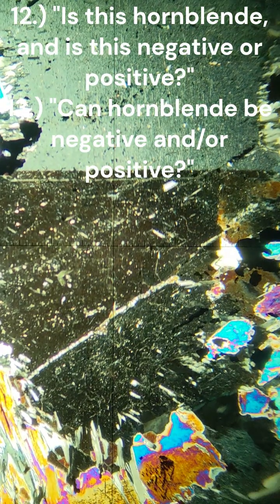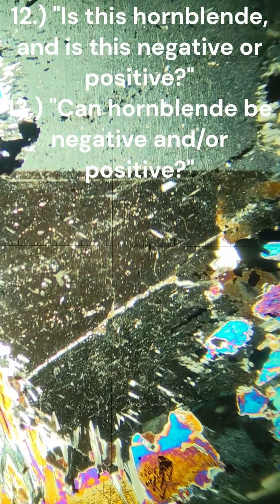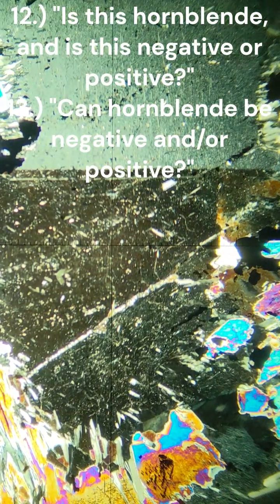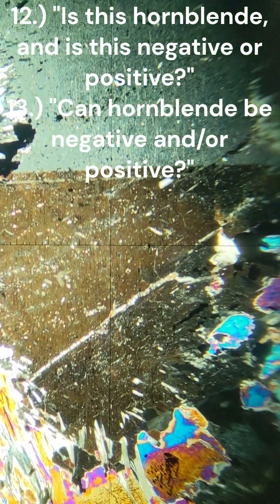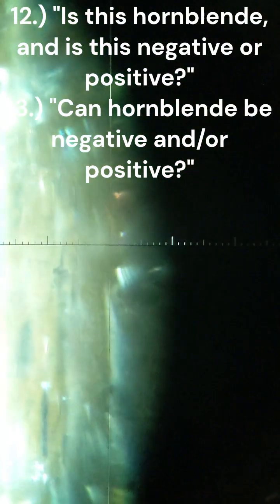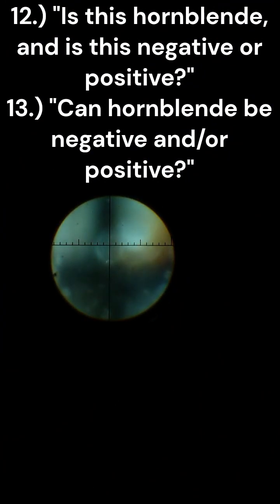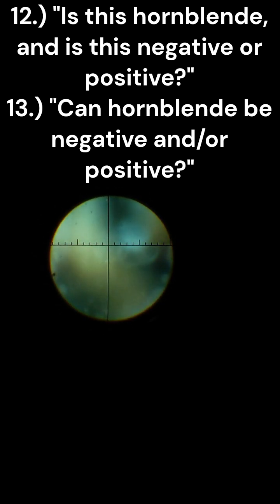We are now focused on the, I guess, southern lower, the other hornblende sample, alleged hornblende sample within this thin section. We are currently on XPL and 4x magnification. I'm going to go to 63x magnification, turn on the Bertrand lens, and try rotating it a bit. You can see that this looks like a biaxial mineral. Putting it right here, so hopefully we can get an optic sign.